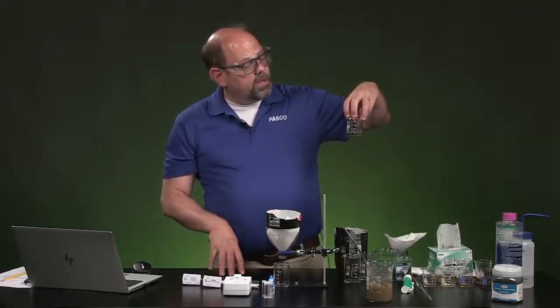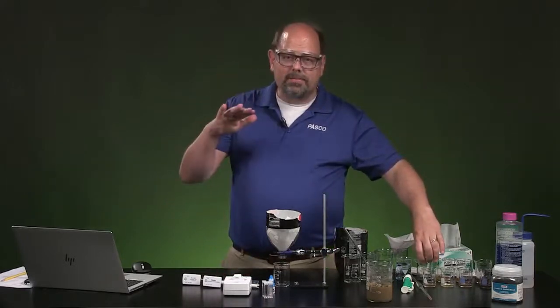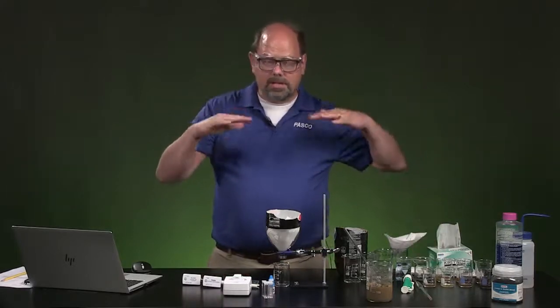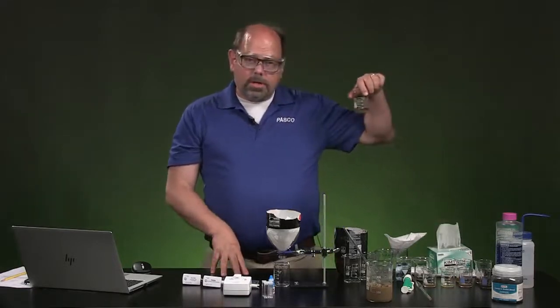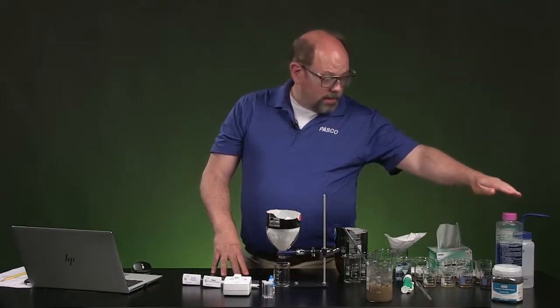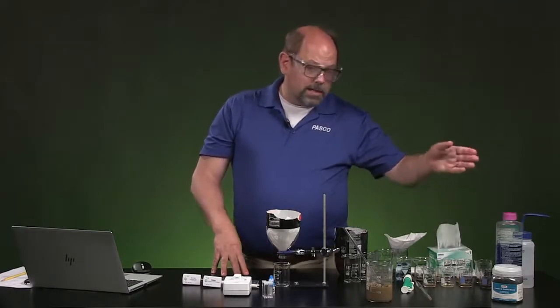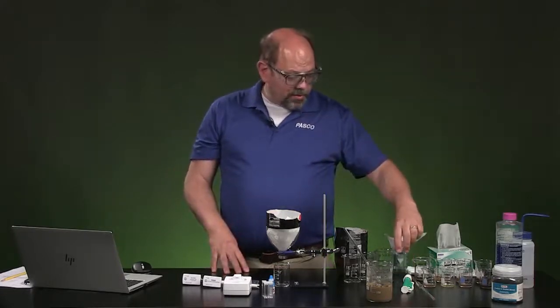The first one that we put in is going to be unfiltered. It's just going to be allowed to settle by itself. If you let water sit, you'll see that some of those particles come out. Next, we're going to take one of these samples and add a little bit of pool clarifier. Now, in the city, they use something called alum. It's a compound of aluminum.